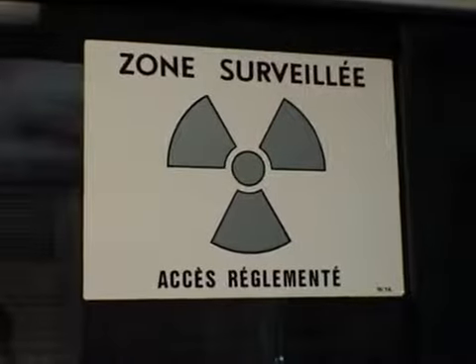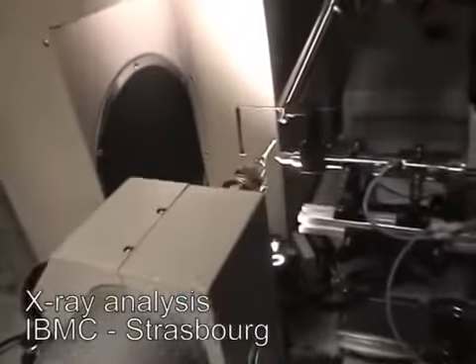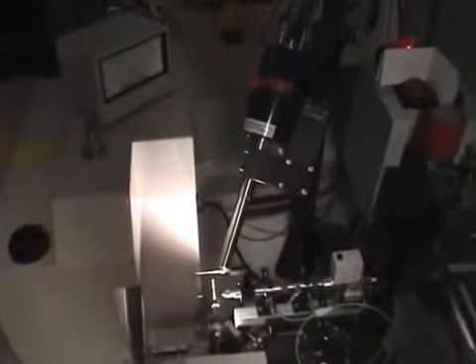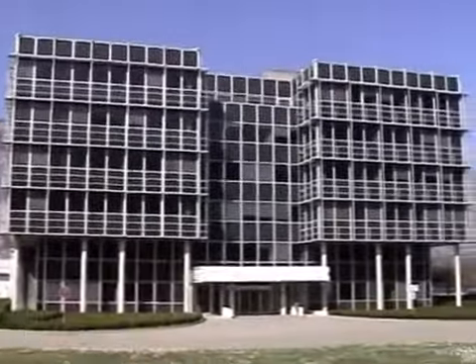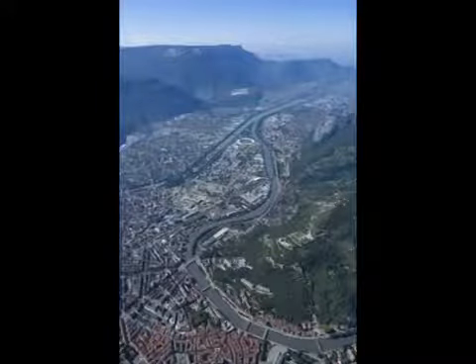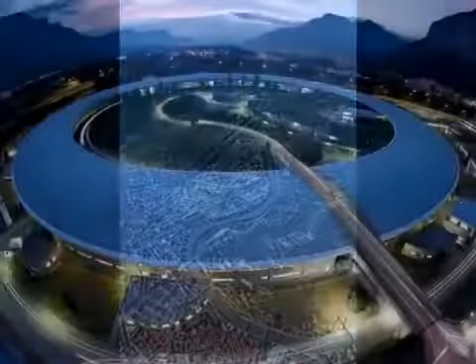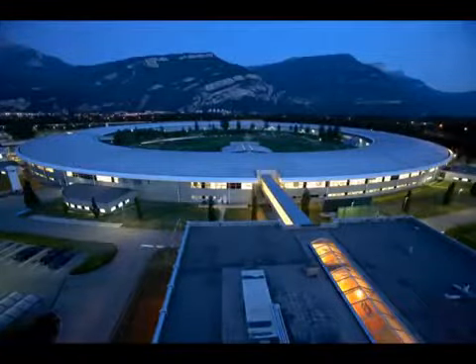The preliminary analysis of a crystal can be performed in the lab. The crystal is placed inside a thin tube of quartz, which is in turn placed inside a beam of X-rays. The diffracted signal is collected with the help of a detector. For a more precise analysis, a more intense beam of X-rays is used. This beam is produced by a particle accelerator called a synchrotron. The European synchrotron in Grenoble is one of the biggest and most powerful instruments in the world.